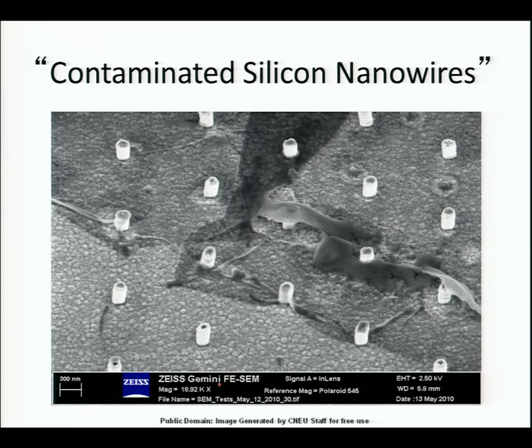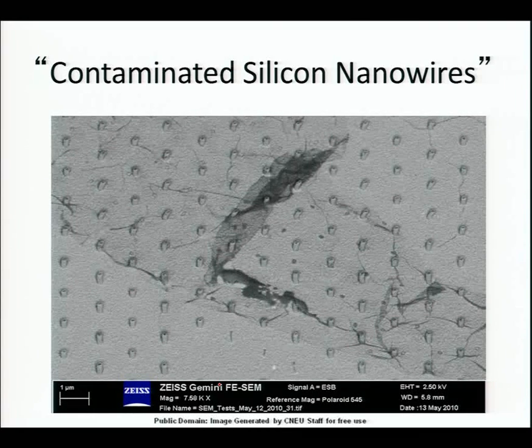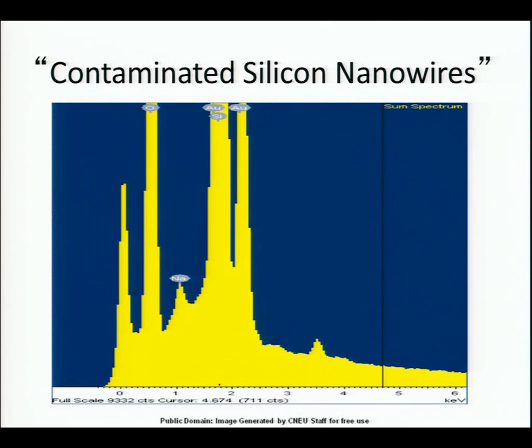These are contaminated silicon nanowires, so we can see that on this system the nanowires are starting to grow, and I think the residual stuff on there is photoresist. We can take a closer look at that on the next slide, or step back and show that same stain, which I think is residual photoresist. When we take a look at that on the sample, we can actually see that there's sodium in there, more oxygen, etc. So this is a look at two different types of silicon nanowires, one which wasn't contaminated with residual photoresist, and the other one that has residual photoresist and a bunch of garbage on there.